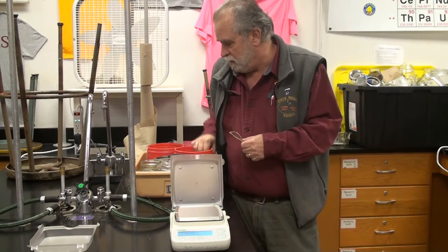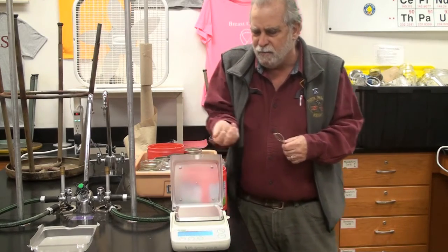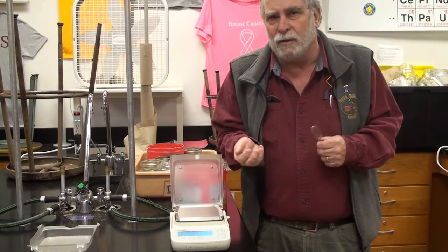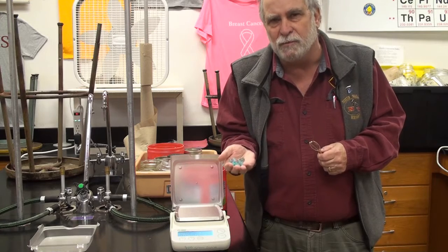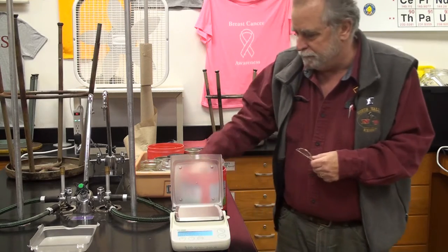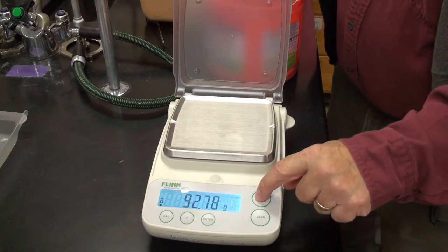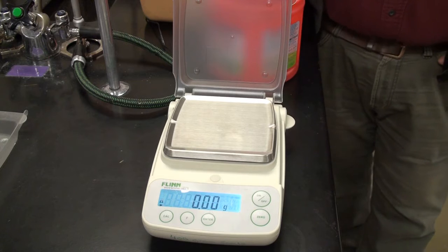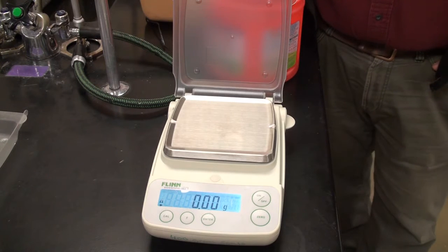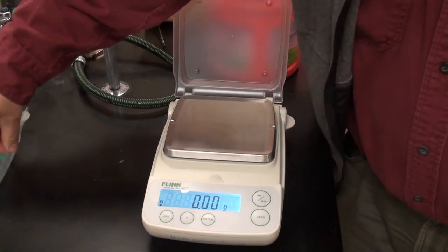Today we are going to use some marbles. And you might think when you look at marbles that they're all the same, but actually they're not. So we're going to find the average mass of various different groups of marbles, and then we're going to use that to count how many we have later on. So what we need to do is figure out the average mass of different samples of marbles. We're going to start off with the blues.